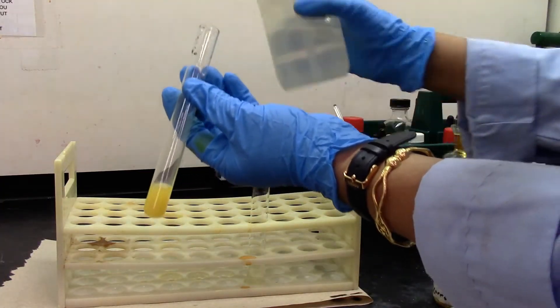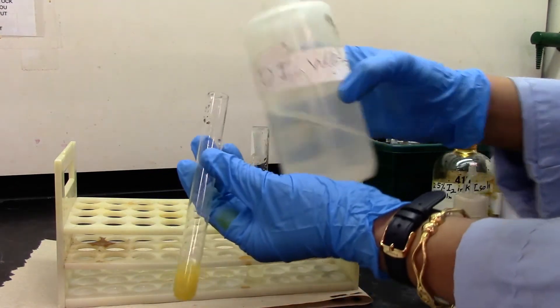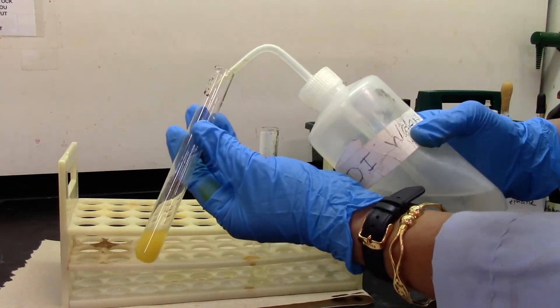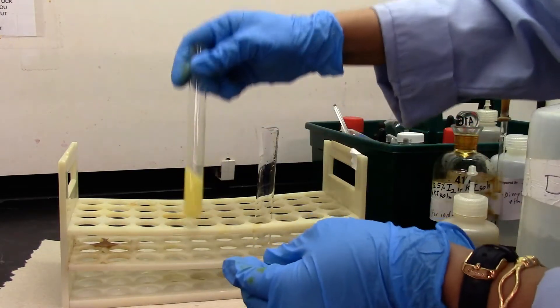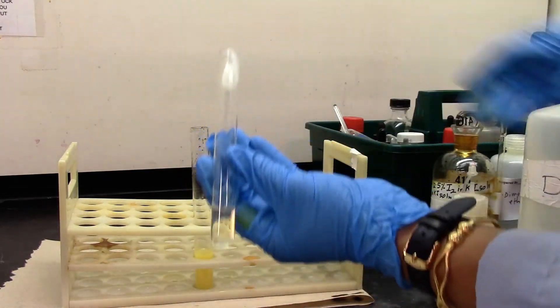Do the same with the negative test. Now we are going to add some DI water.